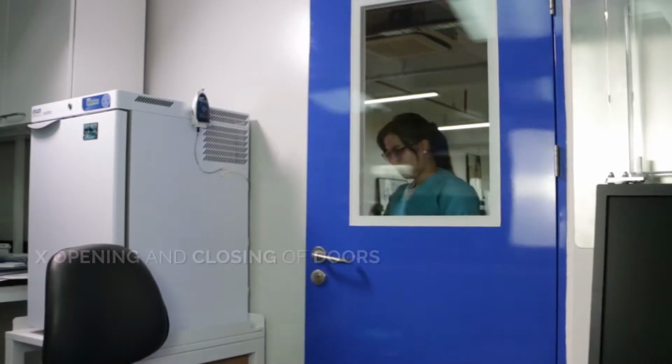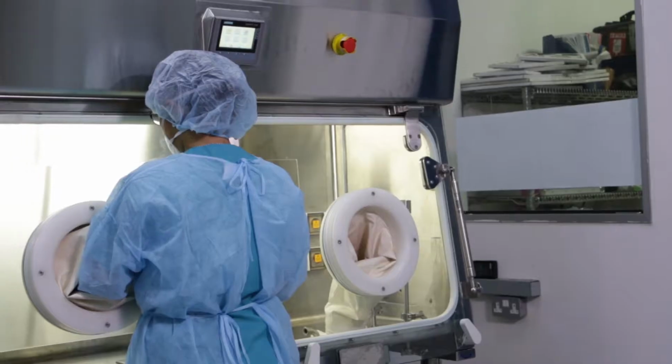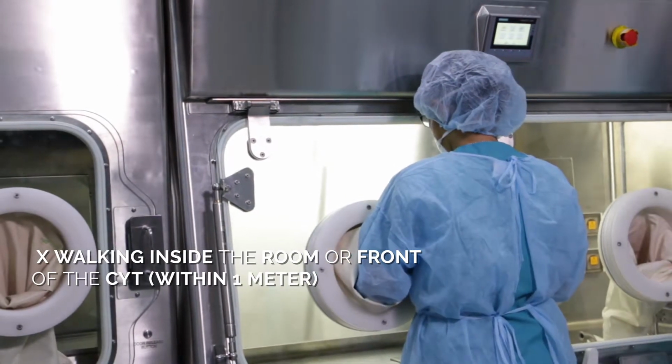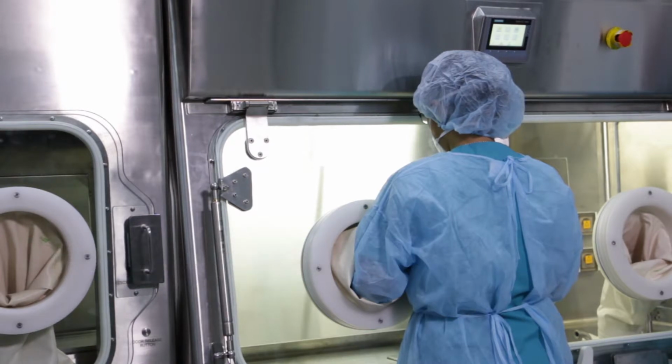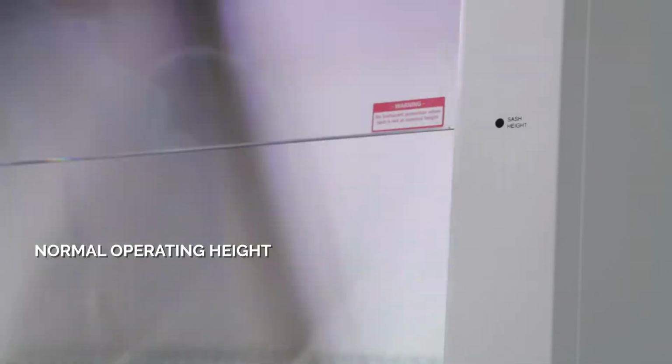Place the waste container inside the cabinet work area. Place all items and apparatus in the safe working area. Minimize room activity, personnel movements, closing and opening of doors, etc., since these external airflow disturbances may adversely affect the cabinet's internal airflow, thereby possibly impairing the containment capabilities of the cabinet. Ensure that the sash is at a normal operating height before starting any experiment.